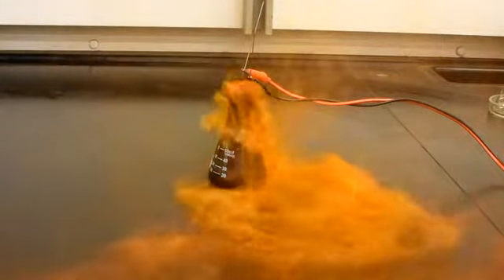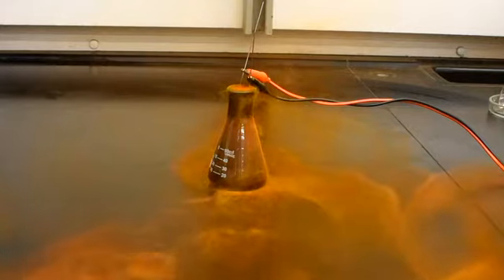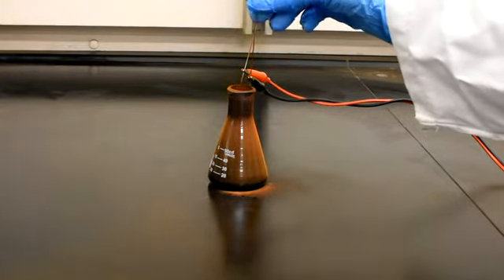in quite a spectacular manner. It may be of interest, but as soon as we saw the reaction occurring between bromine and iron, the heating power across the iron wool was turned off. As the reaction is exothermic, heat is generated, thereby helping to propagate the reaction.